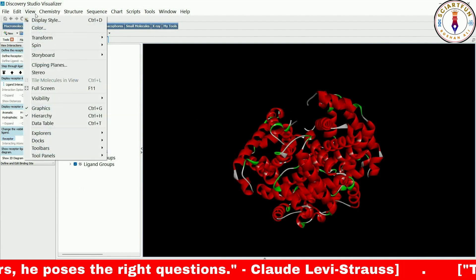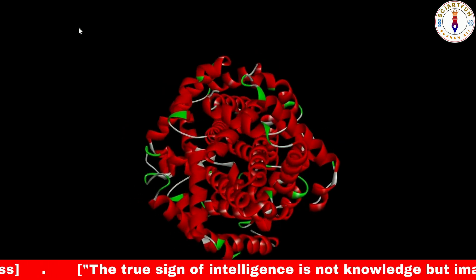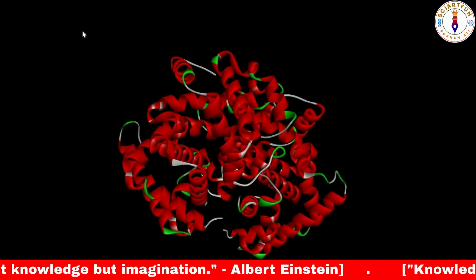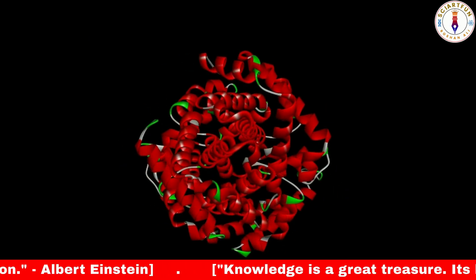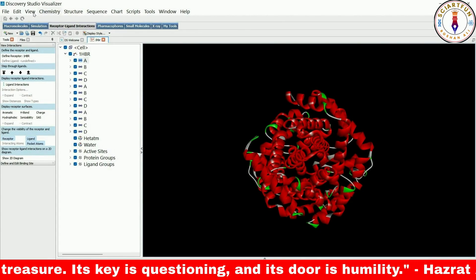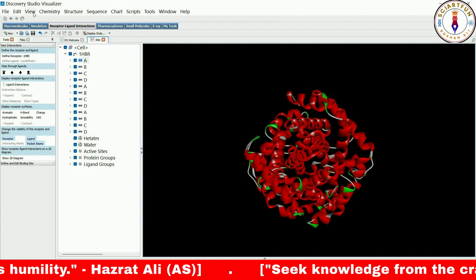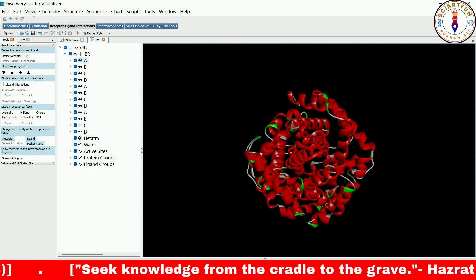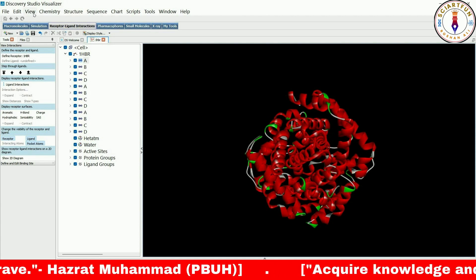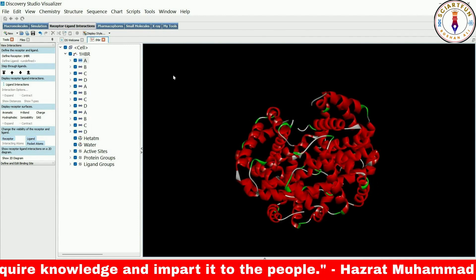Now let's talk about the Spin option. If you click this option, your molecule will start spinning. The Spin option allows you to rotate the protein model continuously, which is useful for getting a better understanding of the 3D structure, especially with complex or large protein models. By rotating the model you can visualize it from different angles. The Rock option causes the molecule to rotate from left to right and vice versa. The Wiggle option is a quicker version of the Rock.